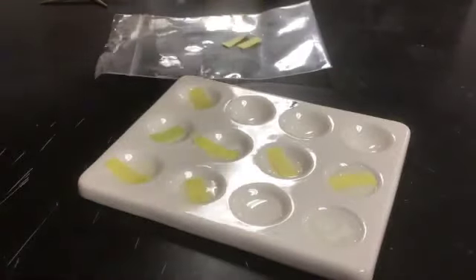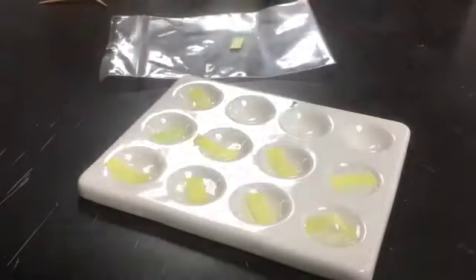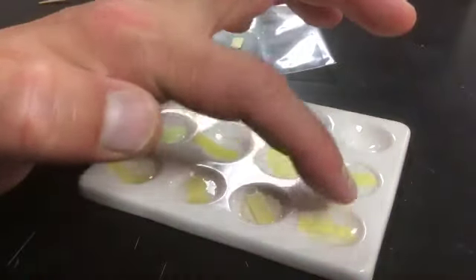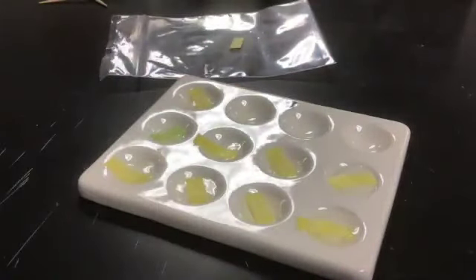All right, it's a great question. So these glucose test strips turn green if there's sugar present. So we're looking for a sugar color, a green color. Now we have to wait a little bit for the action of the test strip. So we'll pause for now, and we'll get the results in 5 minutes.